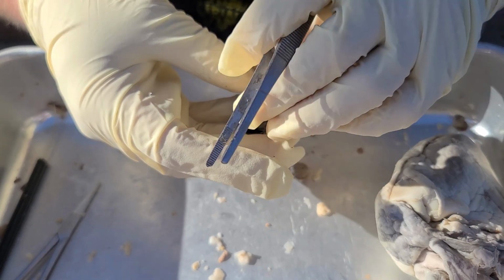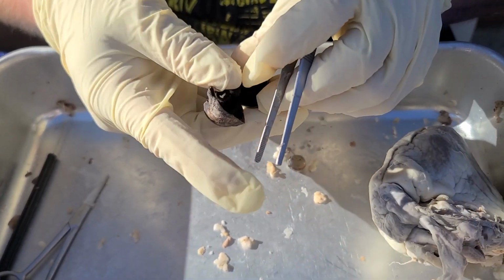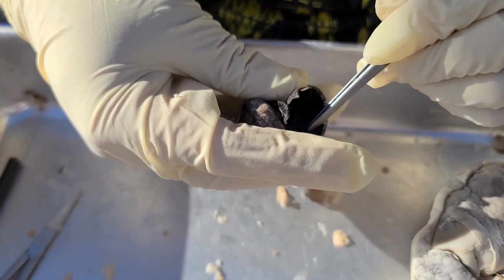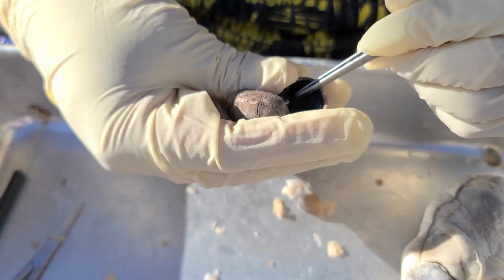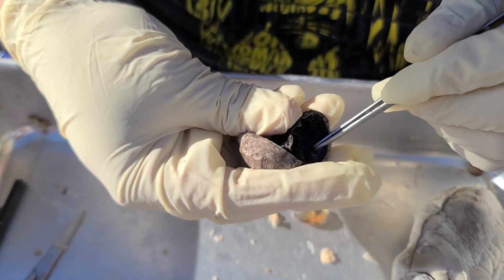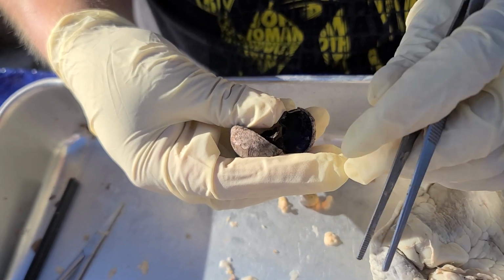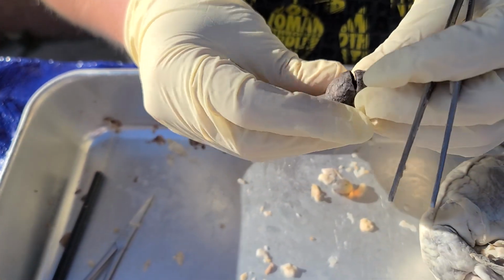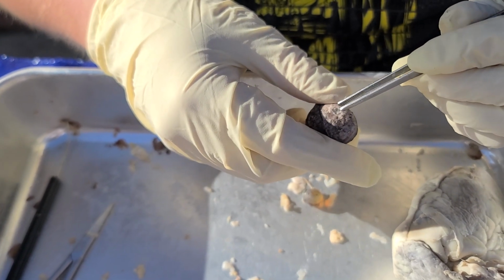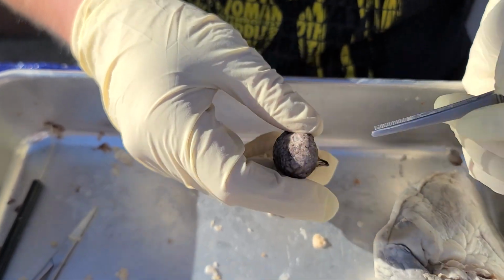is the vitreous humor. The retina also disappeared on me, but there's still a part of it. You can see a little bit of the white. That is what was the retina. The choroid is the black surrounding it, and this blue color that you see right there, which is still part of the choroid, is called the tapetum lucidum. The optic nerve actually disappeared on me as well, but you can see a little bit of the remains of where it was stemming from. And that is the eye.